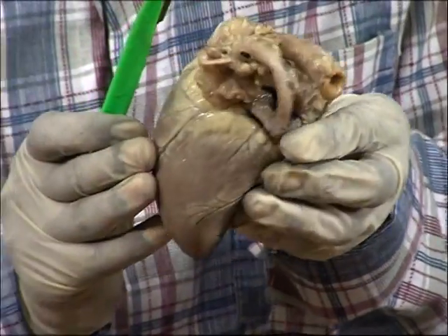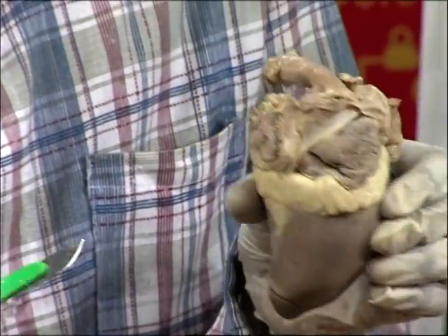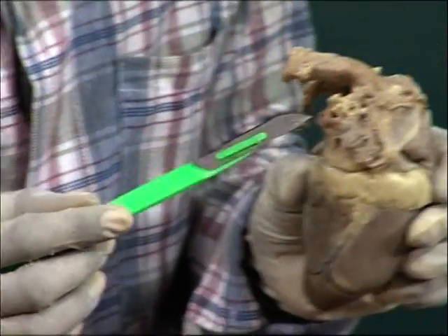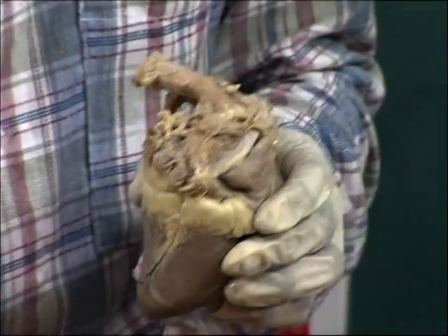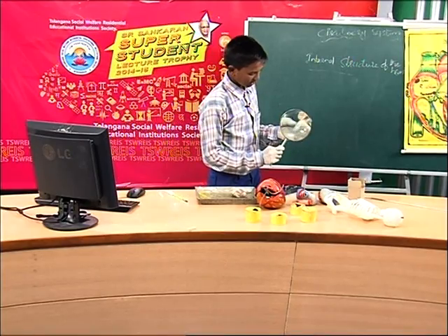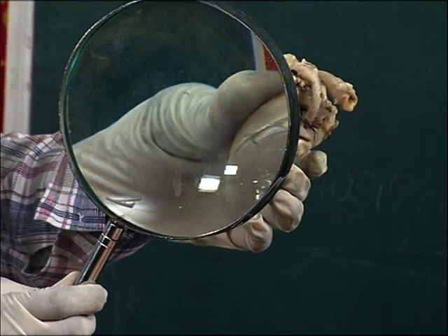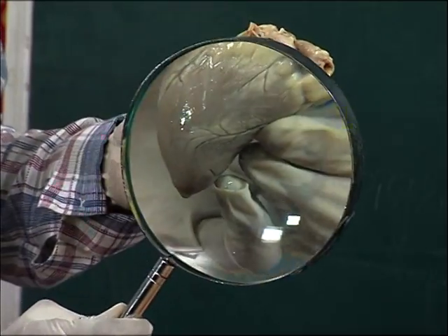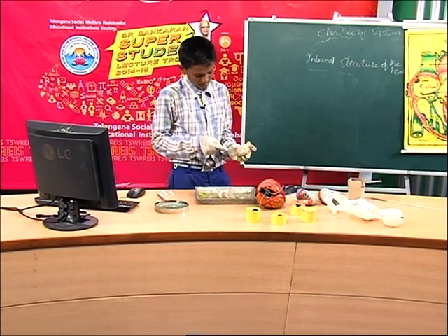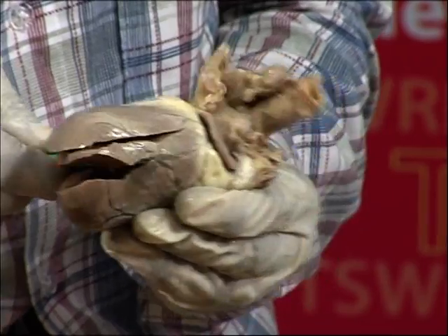So, now I will show like this. So, here you will find, so look at here. Look at here, how I am cutting.